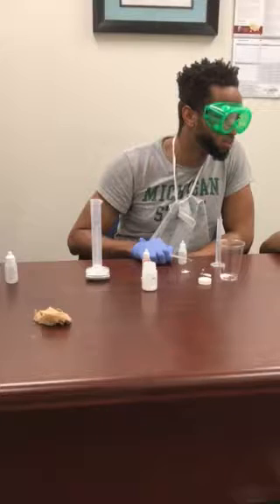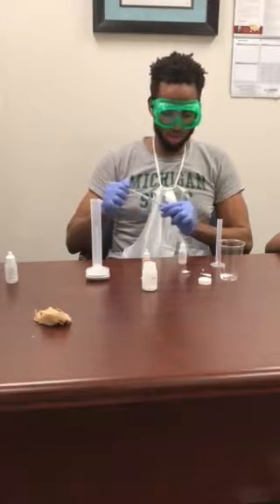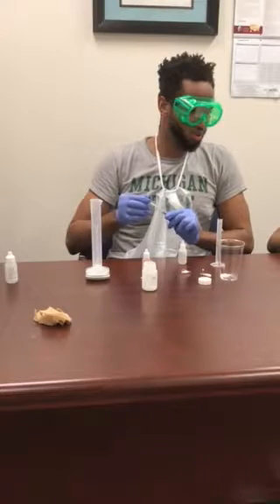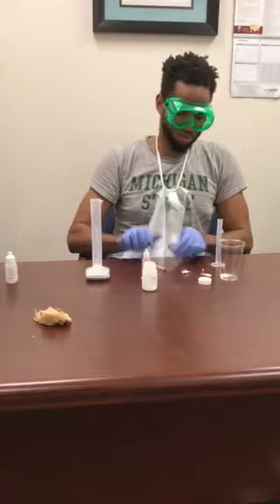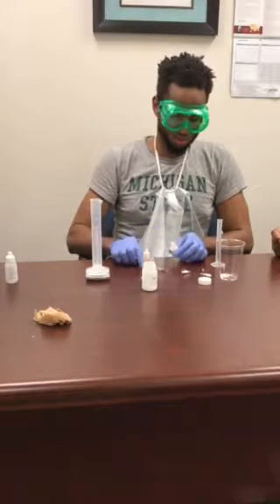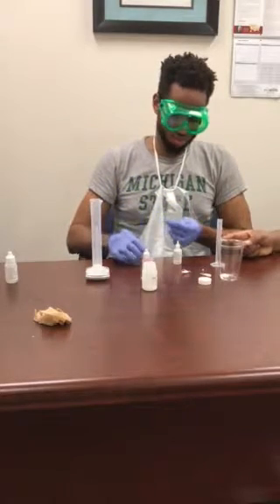Fill the syringe with. Oh yeah, so it's like add it dropwise to the syringe. So yeah, we can really just get it full. Can you unscrew the top of it and try to get just some of it, or is it just the whole cap? Yeah, there's no way. Can you put it in there directly, or could you just pour drops into it?